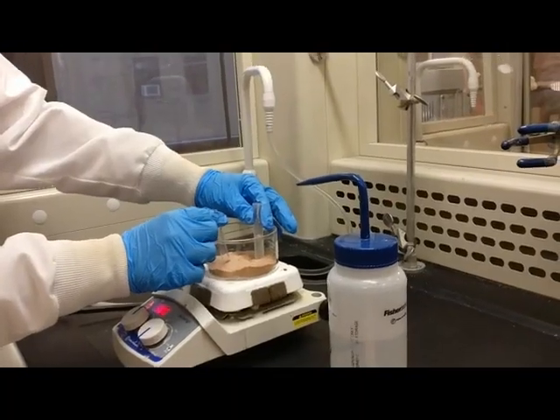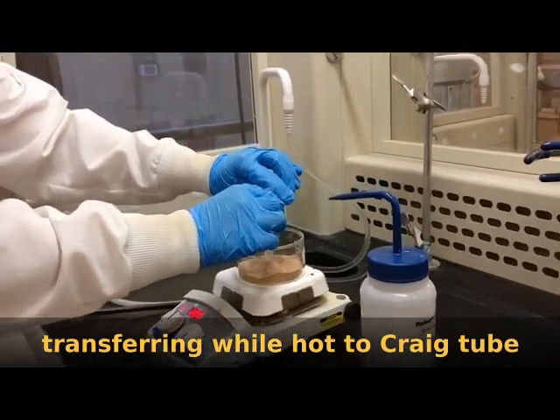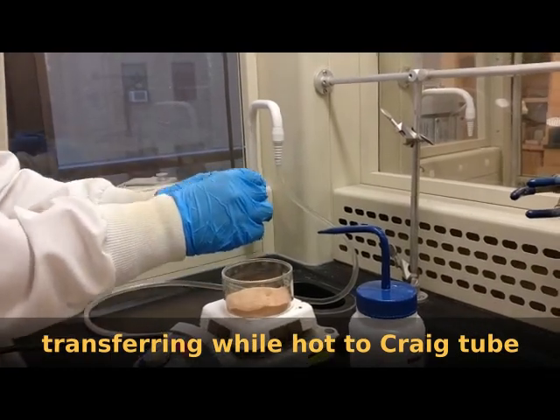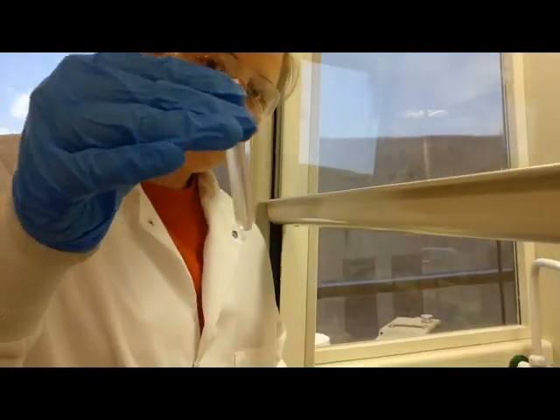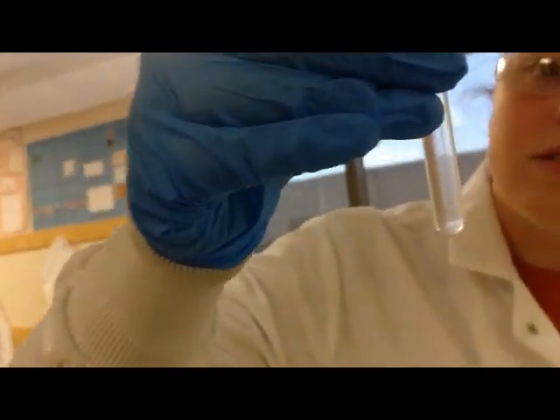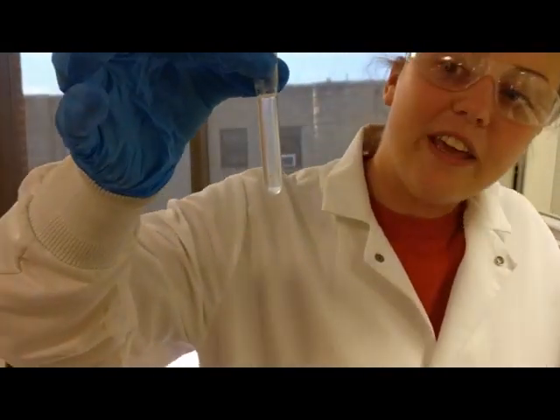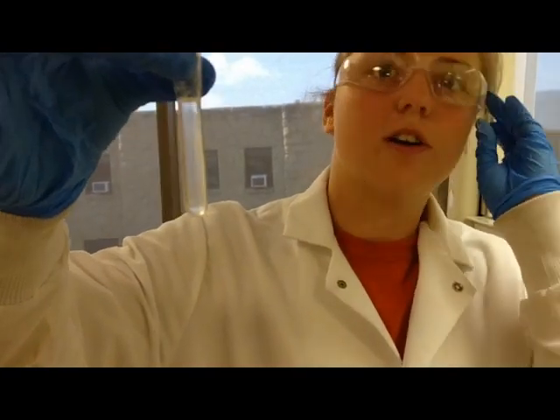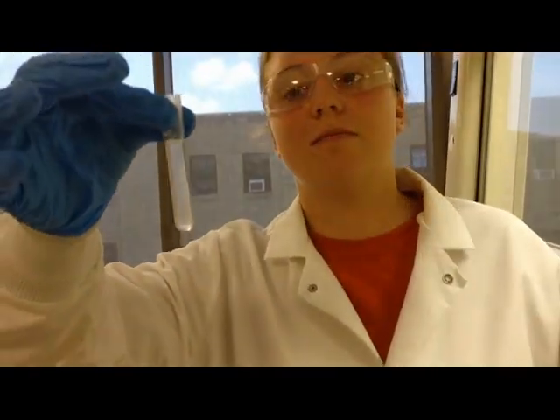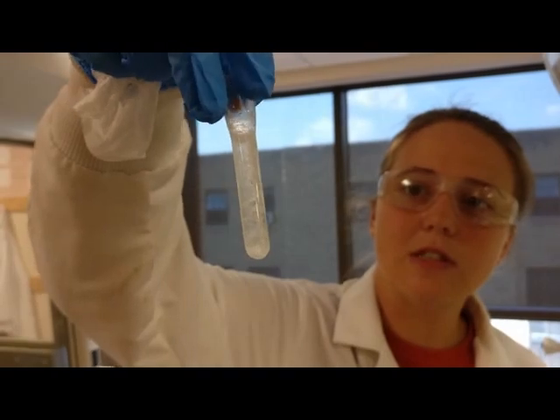Once the solid dissolves, you want to transfer it into a warm Craig tube. And then upon cooling, recrystallization should occur. And you want the cooling to occur slowly to get rid of any impurities. As you can see the crystals are appearing as the solution is getting cooler.